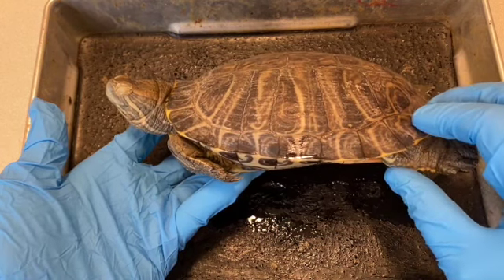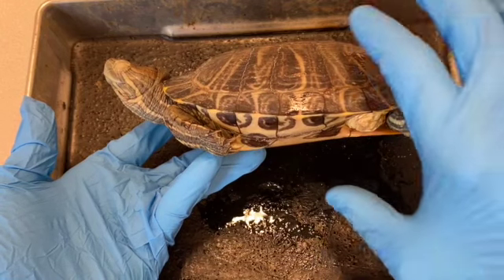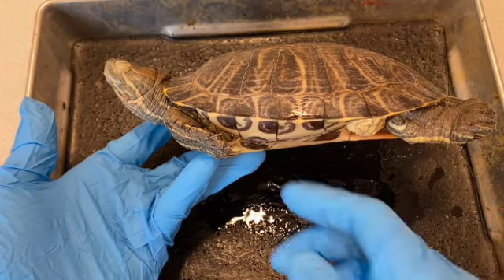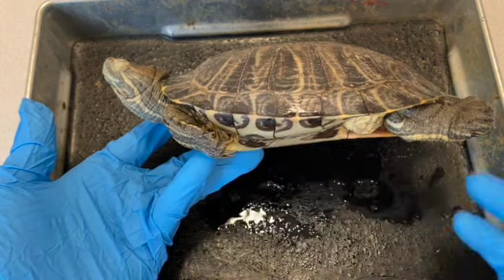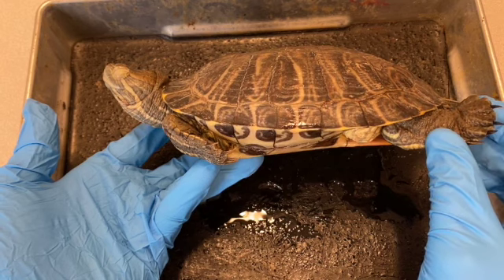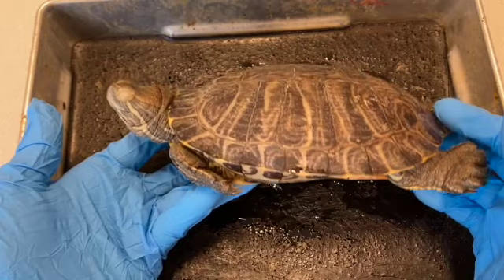By the way, before we start looking at any of the specific anatomy of this turtle, a way you can tell the difference between a turtle and a tortoise is that a turtle has a distinctly dorsal-ventrally compressed shell. It's a lot flatter. A tortoise has a much taller shell. Also, turtles have these long, sharp claws you can see on the forelimb and on the hind limb. Tortoises generally have either much shorter claws or a more club-like foot rather than this flattened foot.